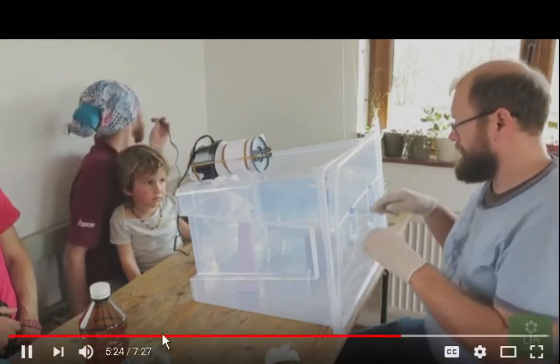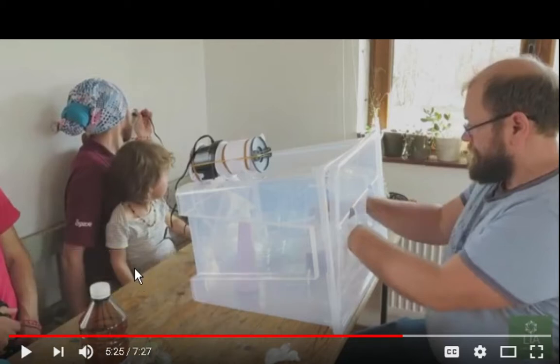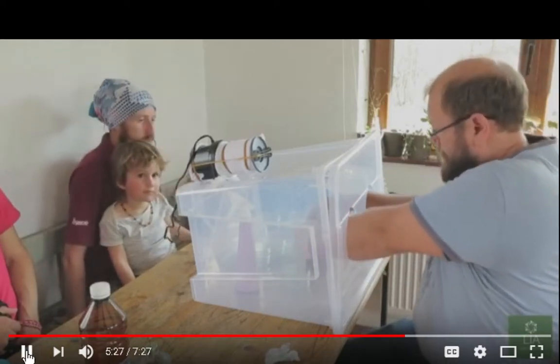Okay. I wonder if you could do that with the cotton on top of the flask. There's a 250 Erlenmeyer flask. I was thinking maybe getting that. That would be my final transfer of solution rather than a jar. And the flask, the other video, I could show you that video. I think I know where that video is. We could run that video. That'd be a good comparison.